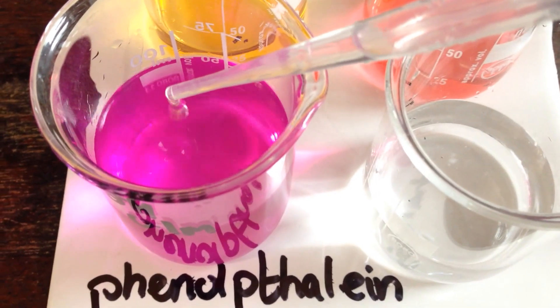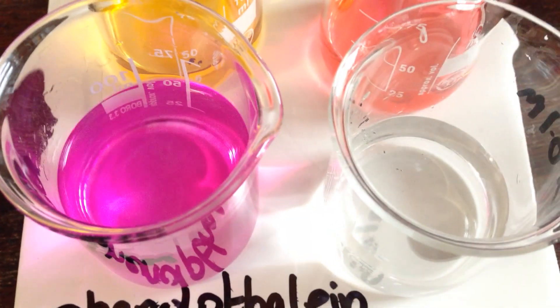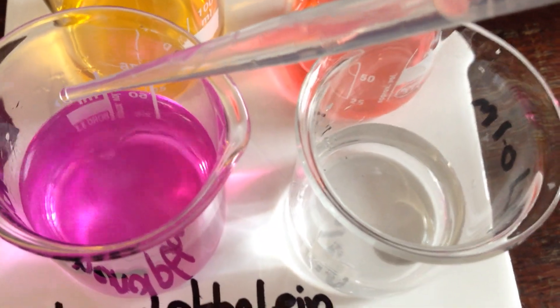When you're doing this as a titration, remember you need to be swirling after every single drop is added. I'm just doing this as a rough guide to show you what happens.